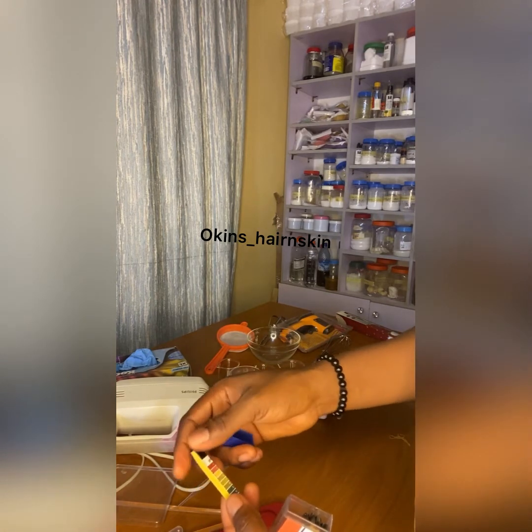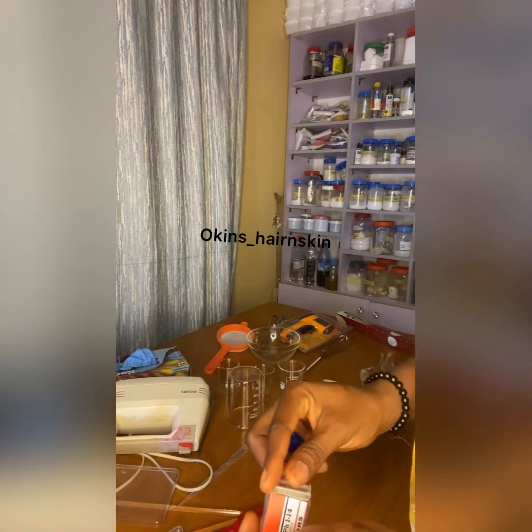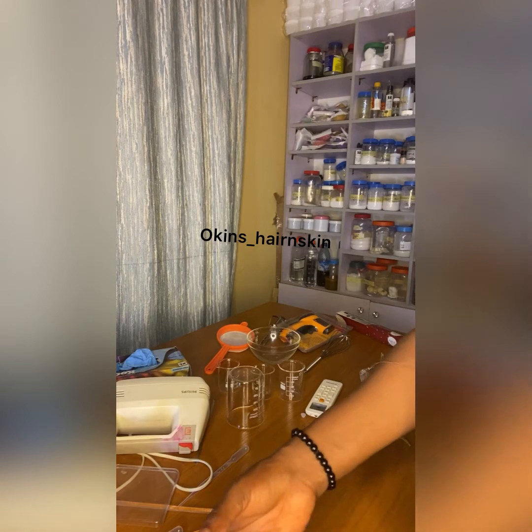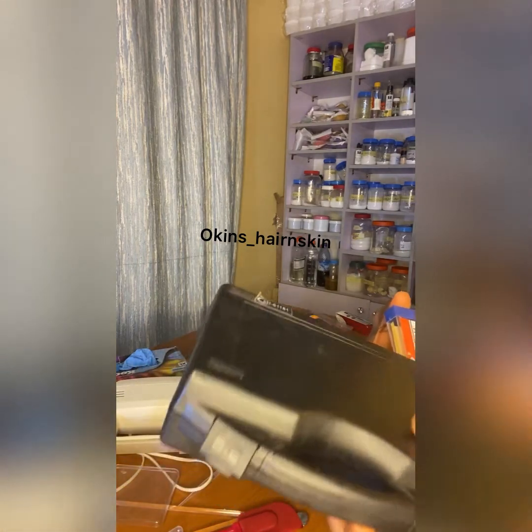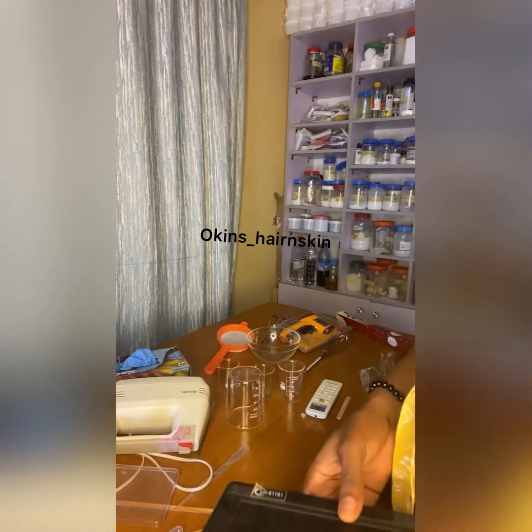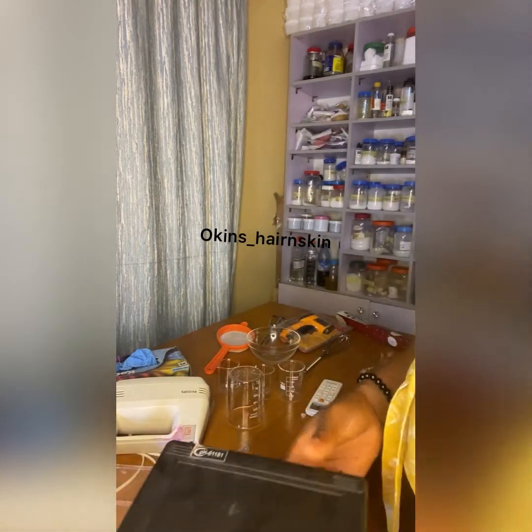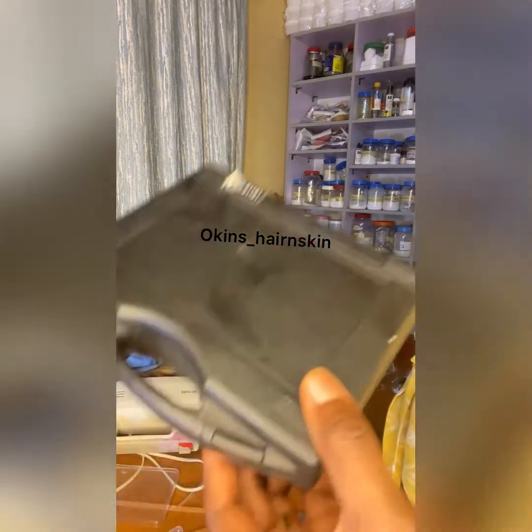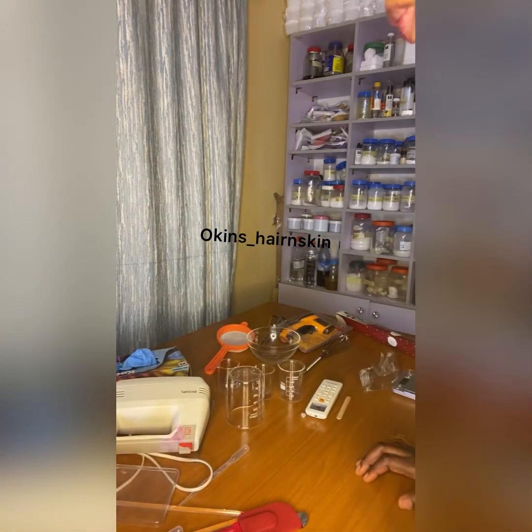So you see, it's not too accurate to me. If you're able to get this bigger one, I would recommend it as a beginner. It's even better you start with this, because this will definitely give you issues, because it won't give you an accurate result. But if you're not able to get this one, you can start with the pH strips.